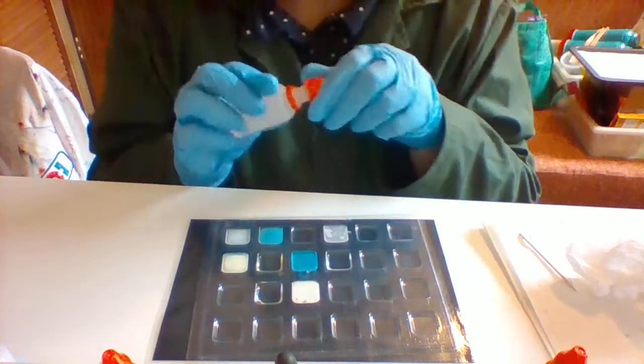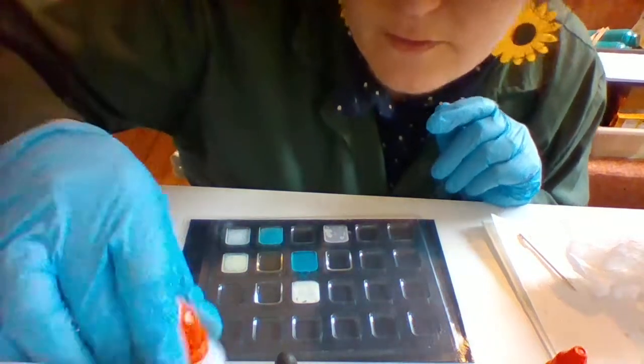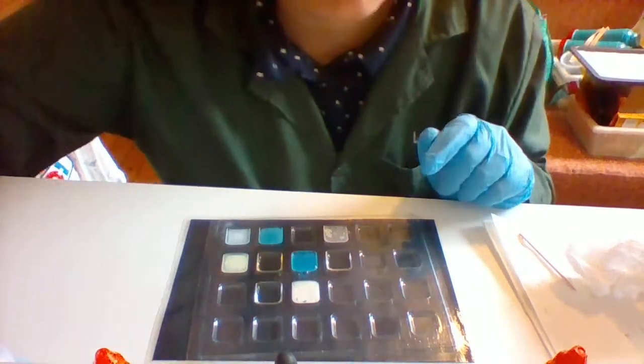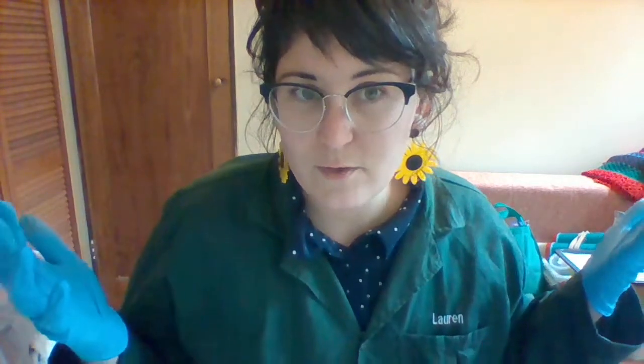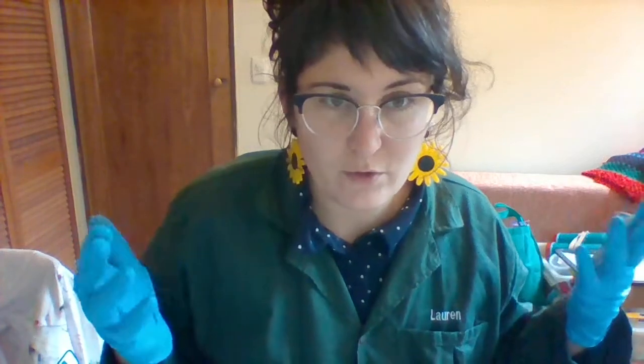Ooh, and look at that. Nothing really happened. Okay, great. So just make sure you've written down all of those reactions and the results that you observed. If you can't see it very well, just kind of write down what you can see. Okay, bye.